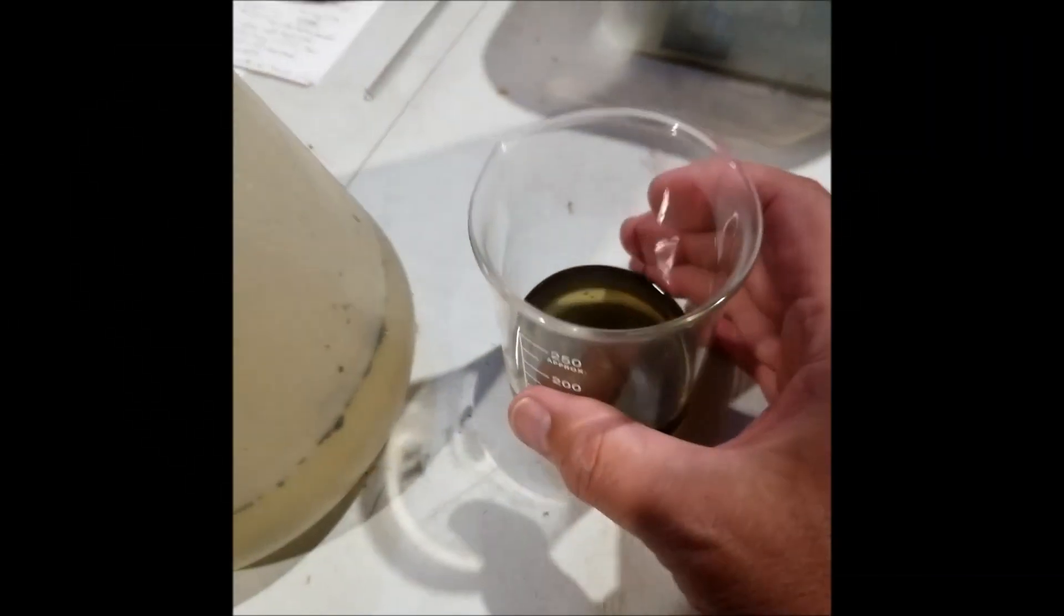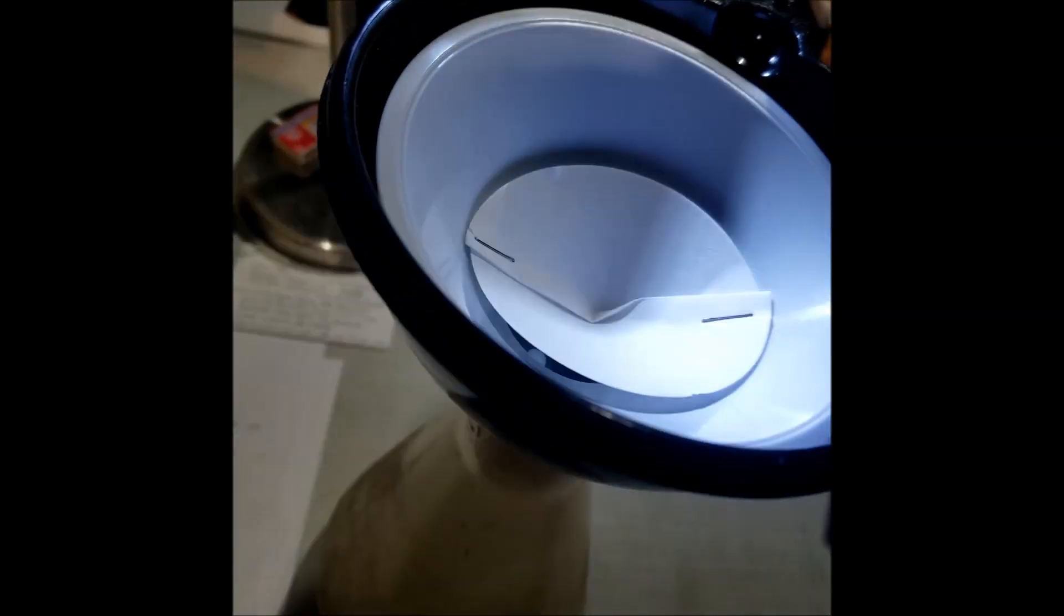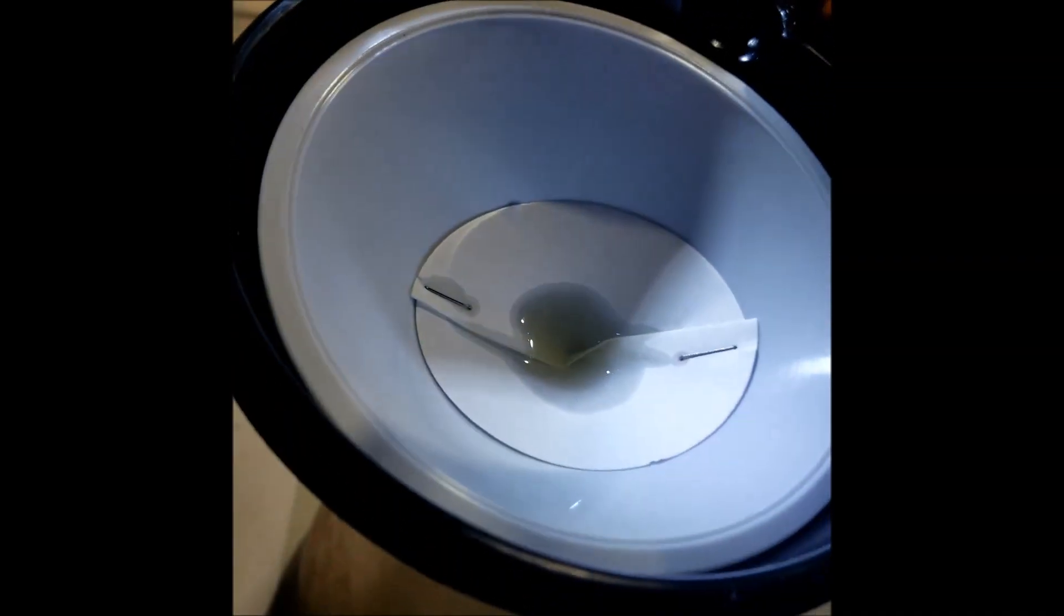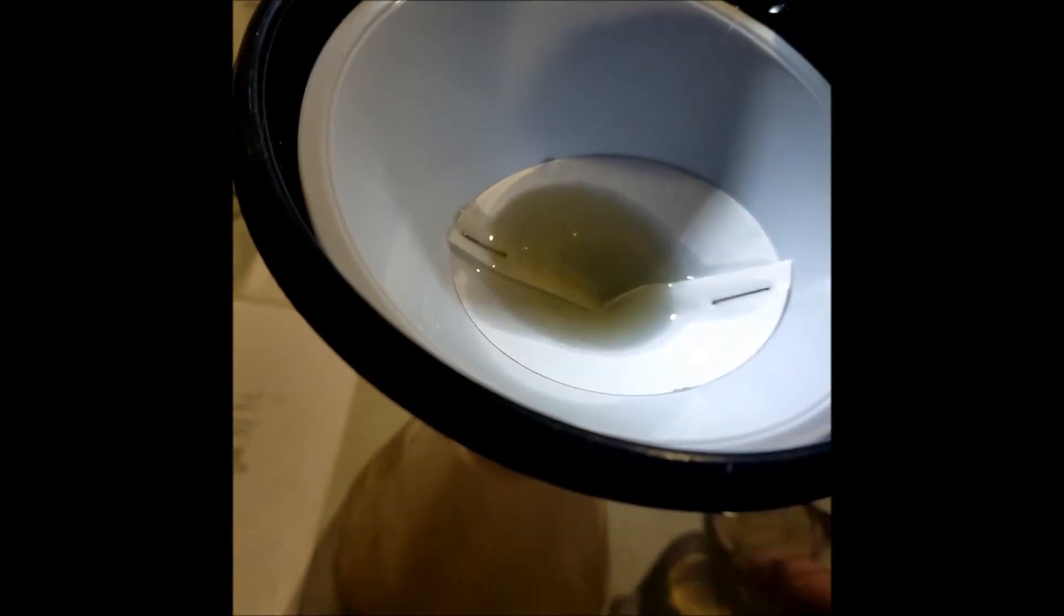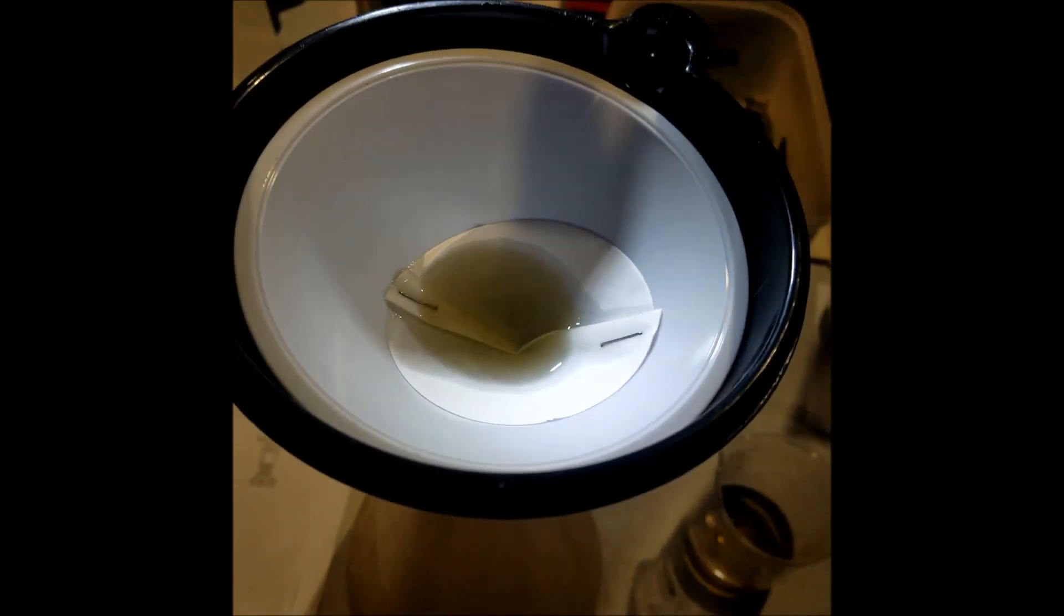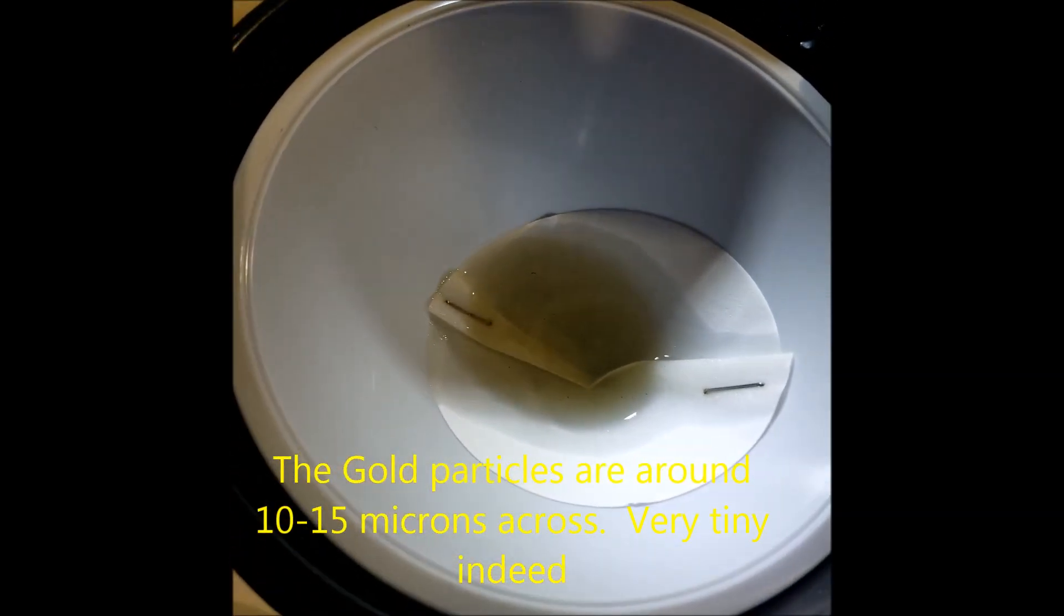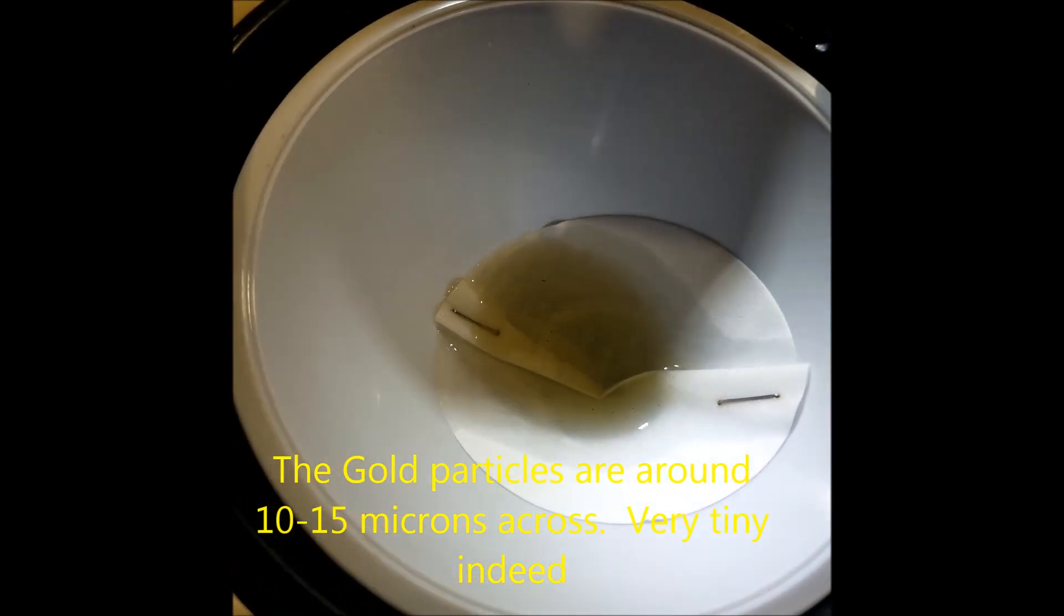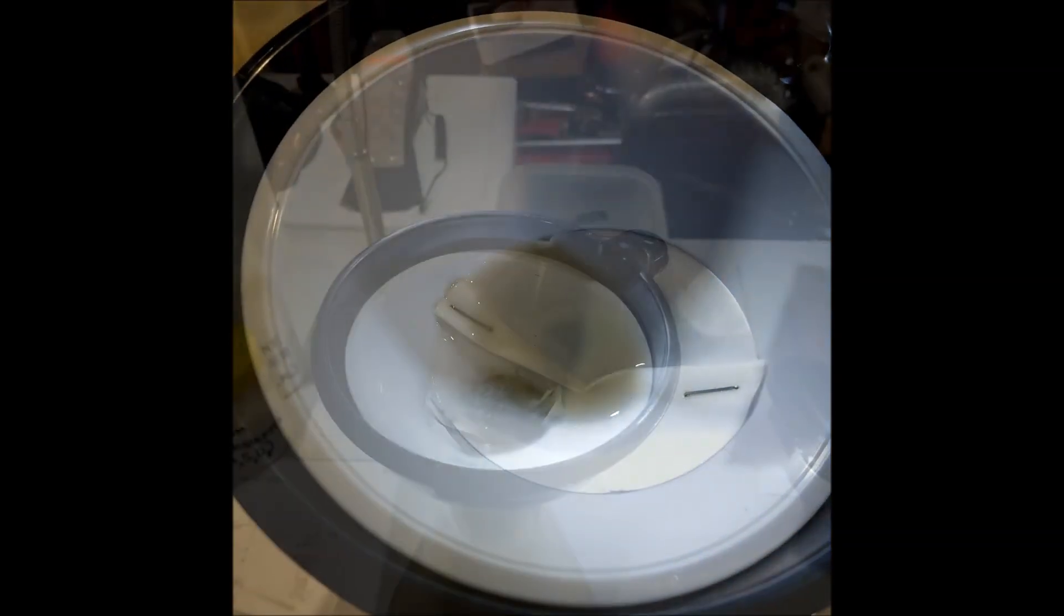At this point, we're going to filter this liquid with the gold sitting at the bottom. I moved this to a smaller beaker. This is a real filter, not a coffee filter, and it's needed to collect the small particles of gold. It's going to take some time. We'll come back to this.